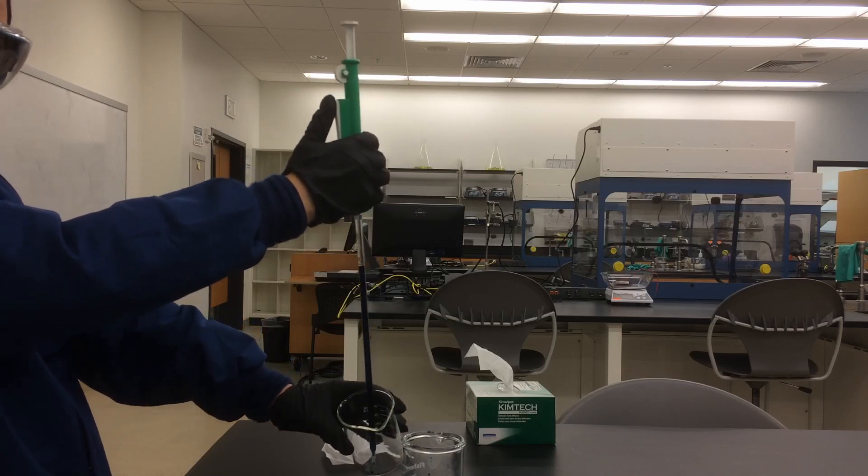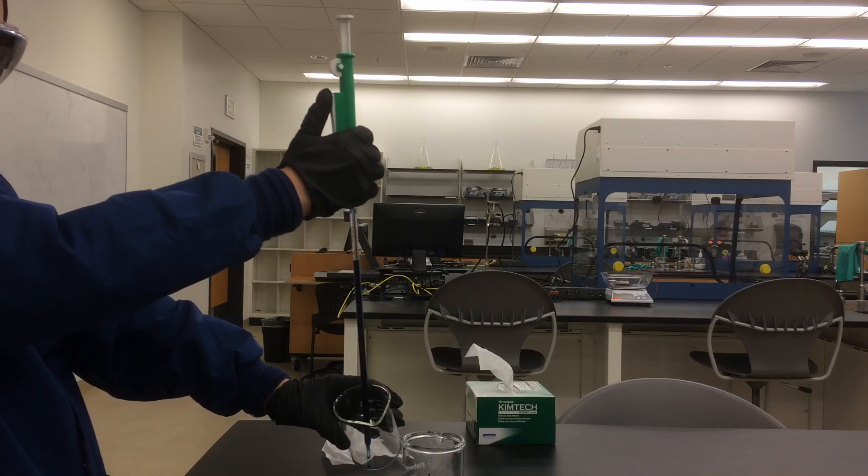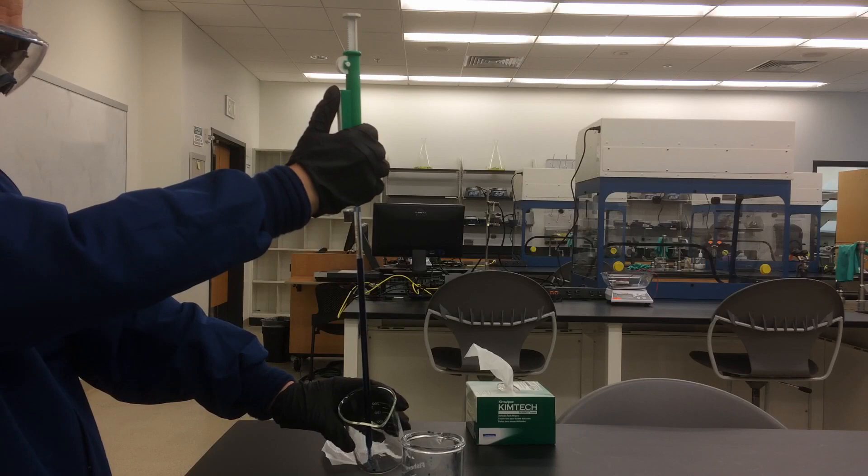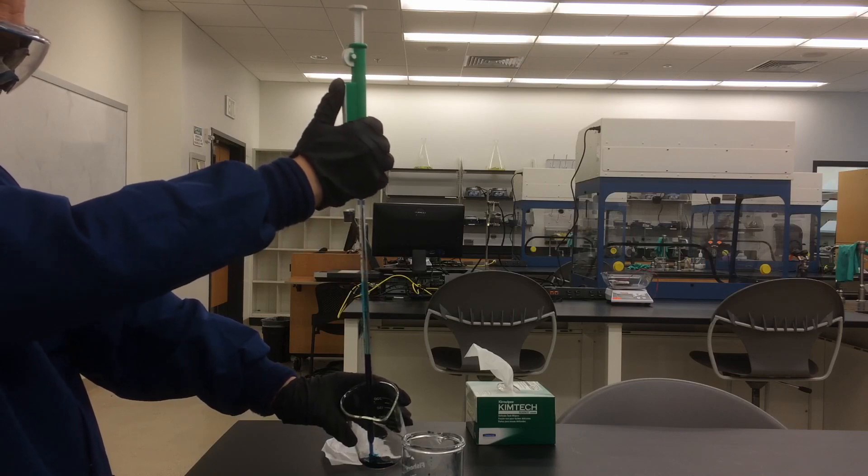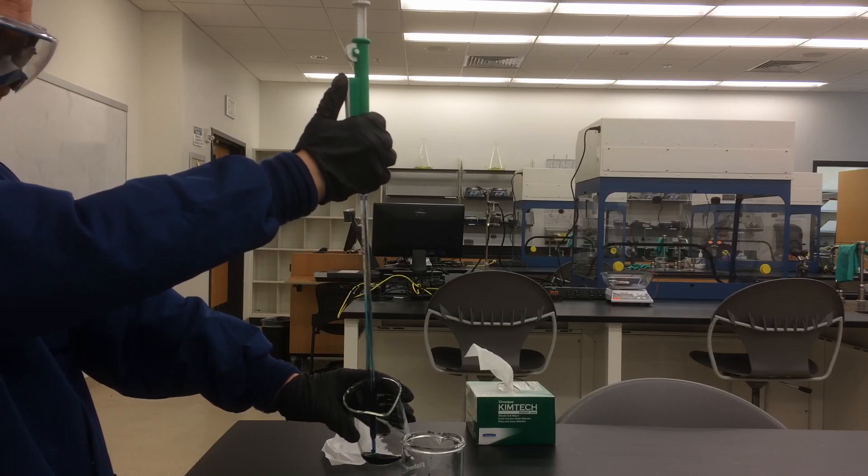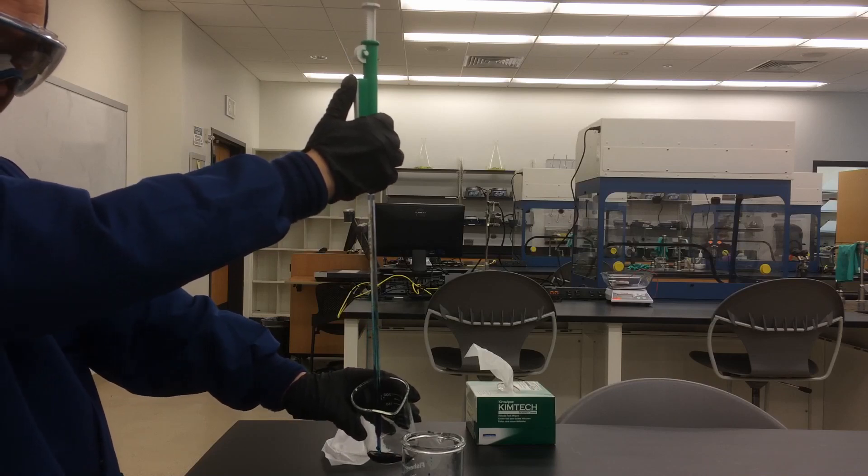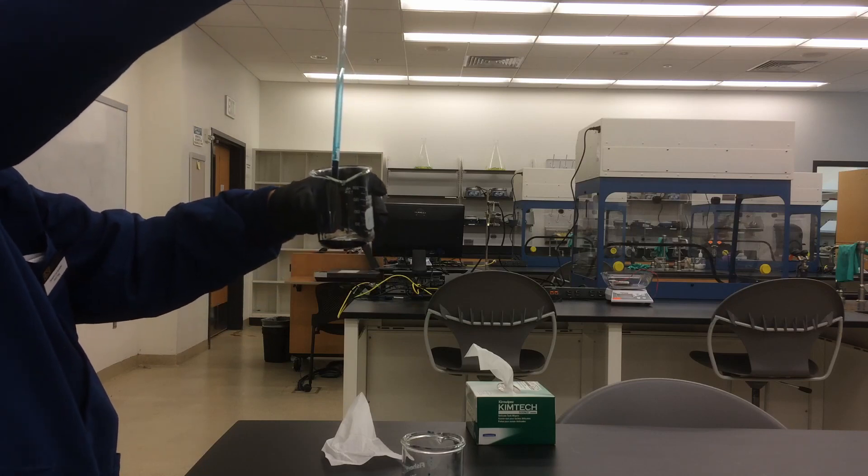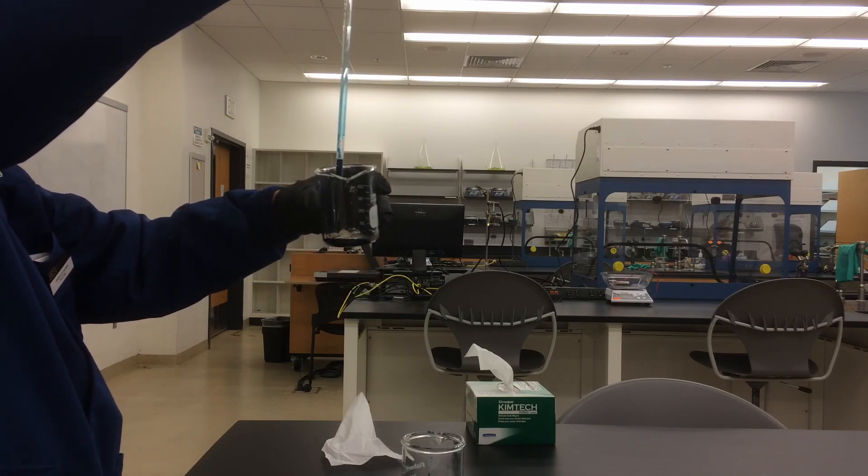And press the lever on the side to drain the solution until the bottom of the meniscus is on top of the four milliliter mark.